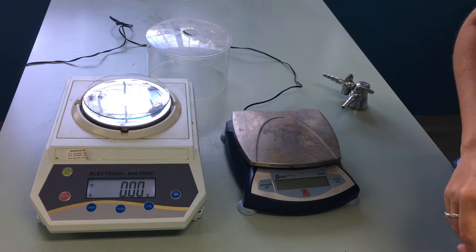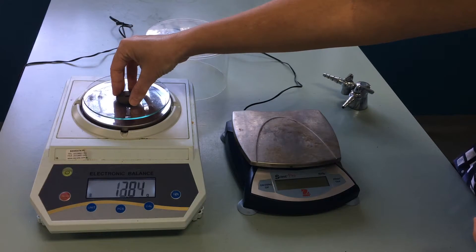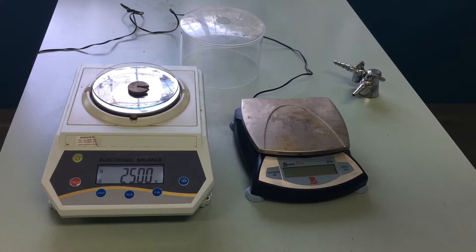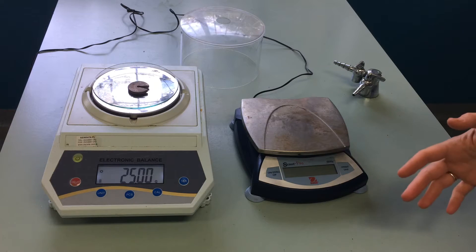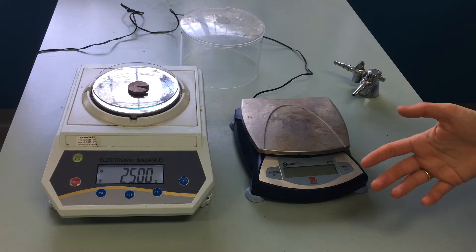Now your balance is ready to weigh a mass. Be careful when you take your reading that no one's bumping the bench. The balances are quite sensitive, and this could affect the reading you get.